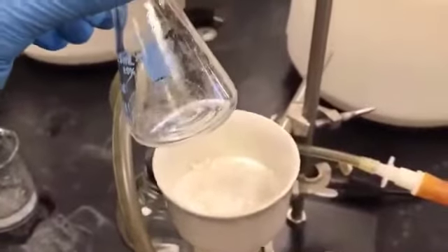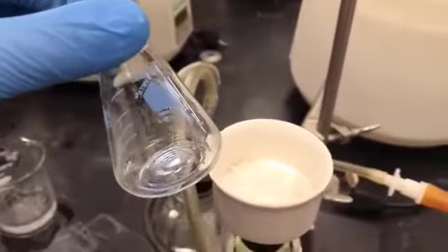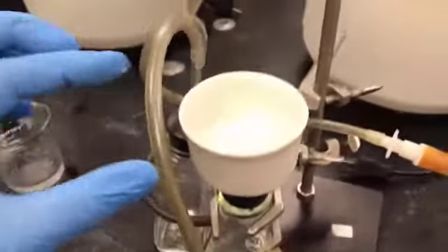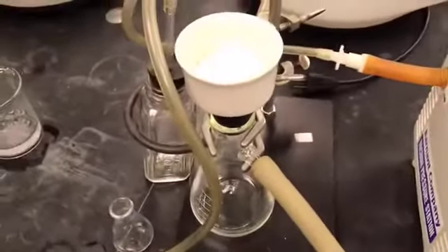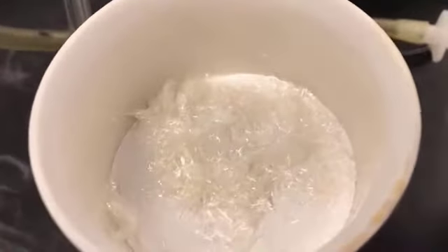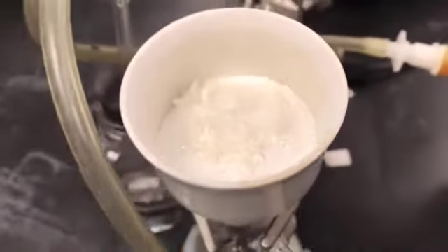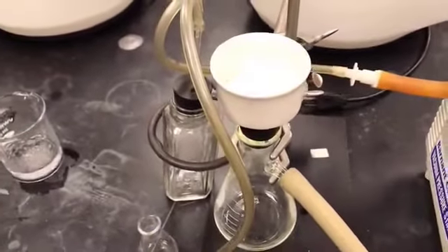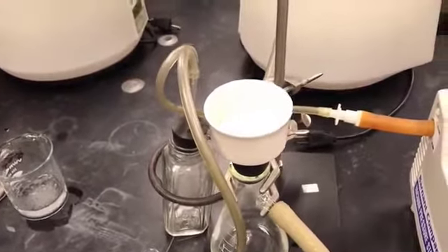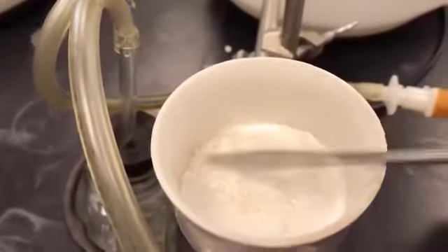It took 4 milliliters. If you add more, you are dissolving your sulfanilamide into the ethanol, and then it will pass to the filter. So you will lose your crystallized sulfanilamide into the filtrate, and the recovery will be lower. So you should use the minimum amount required to transfer the crystals from the Erlenmeyer flask to the Buchner funnel, and the ethanol should be chilled. If it is at room temperature, the solubility will be higher. In chilled solvent, the solubility of the compound is less. So it's very important: it should be a minimum amount of ethanol, and it should be chilled.